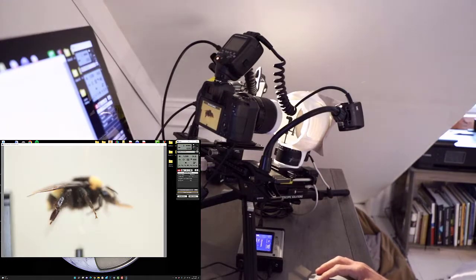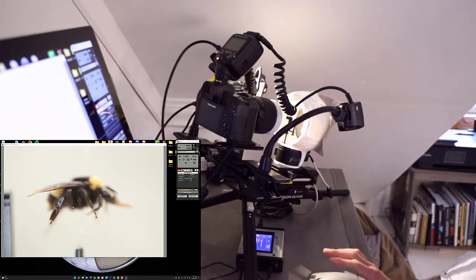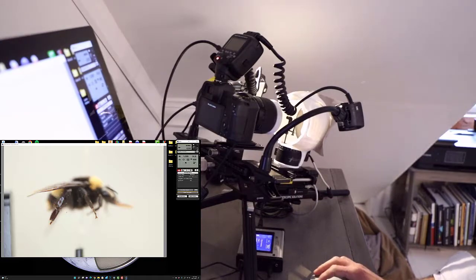Okay, so now you can see what's happening is the glare is actually kind of moving to the outside. So the center is actually going to be a little bit better placed. So let's actually leave it there. We're still going to get a little bit of glare, and I think here we're as close as we're going to get before having to adjust and show how we can really just get rid of it altogether using post-processing like Photoshop.